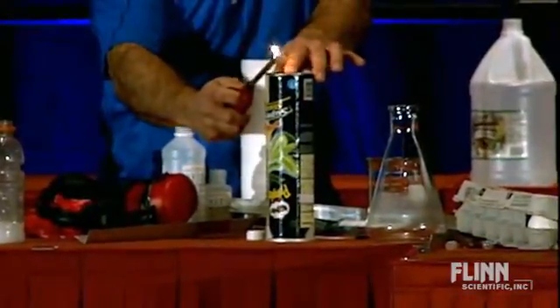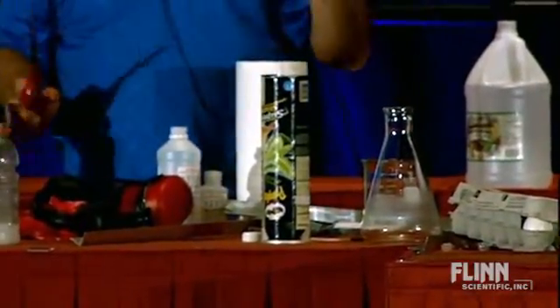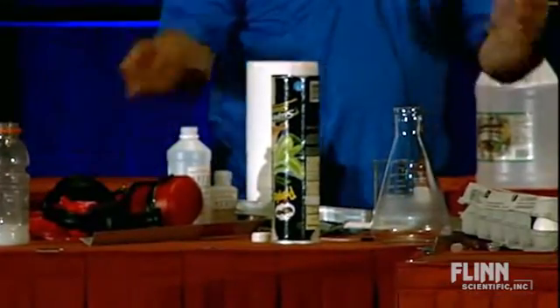Hopefully I get this lid in time. There we go. It lit, but you were expecting a loud bang, weren't you? That's a lot of hydrogen there.